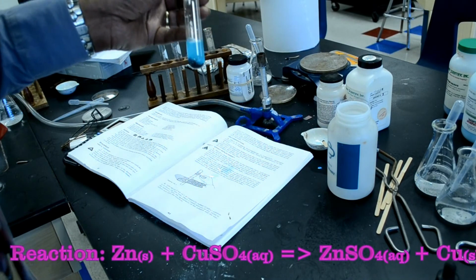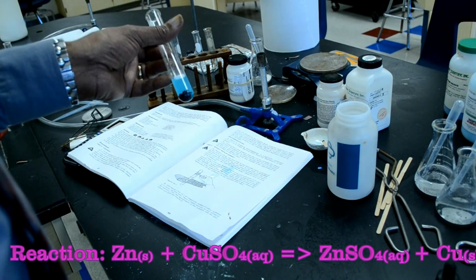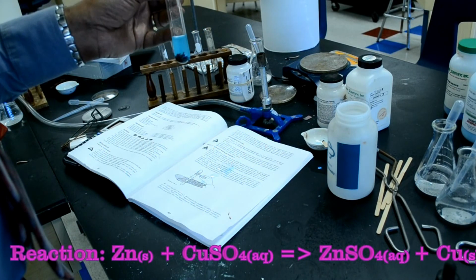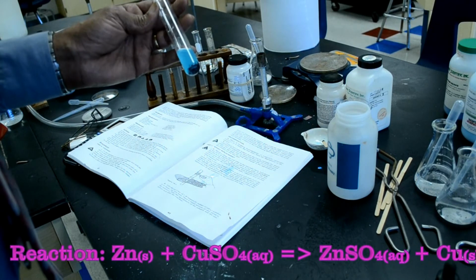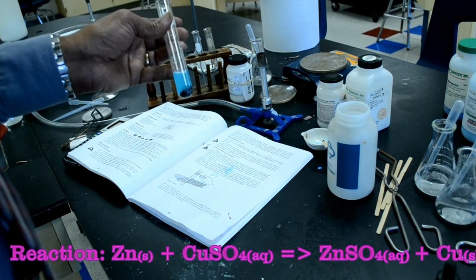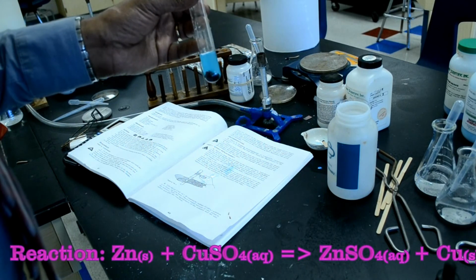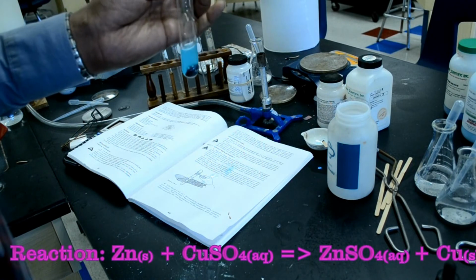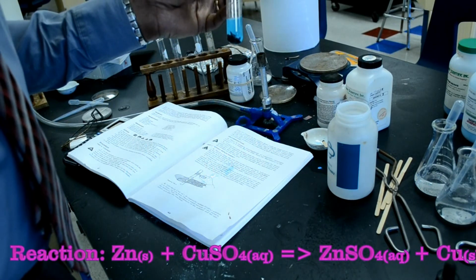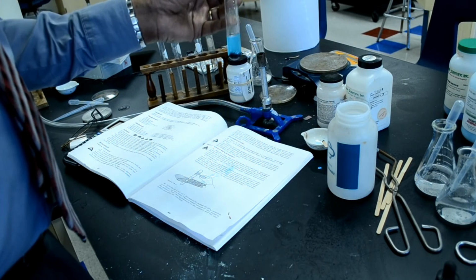There it is. So the zinc is starting to turn red, which means that the copper has come out of the solution where the copper 2 sulfate was added to zinc, and now the copper is being exchanged for zinc. This is called a single replacement reaction, where copper is being replaced by zinc, forming copper metal. You can see the copper metal forming in the test tube. We'll come back to this later to see how far the reaction actually proceeds. But you can see the zinc is actually replacing the copper in solution.